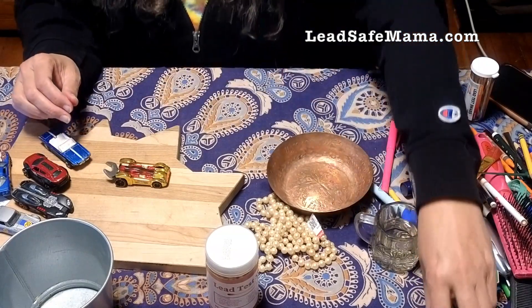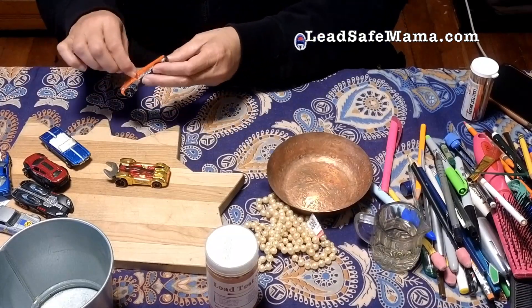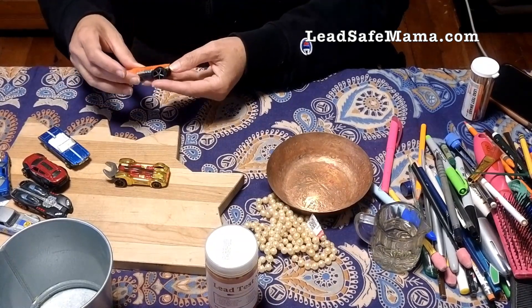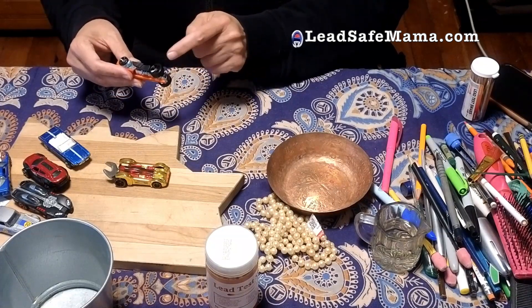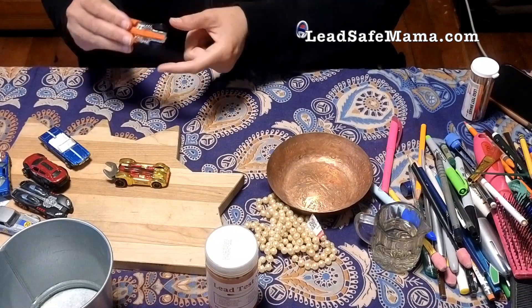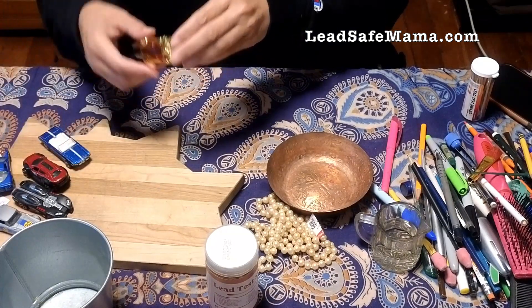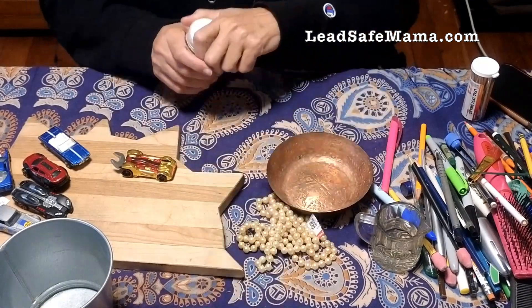Some from the seventies have plastic components where the upper plastic component has lead and/or cadmium, but that's only an issue with ones from the seventies and before — and again, they would have the rubber wheels. So if you have hard plastic wheels and a newer date of production, especially if you purchased them new after 2011, they are lead free. And this is a lead-free matchbox car, tested by me just now.